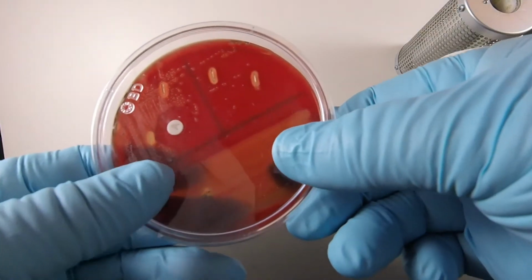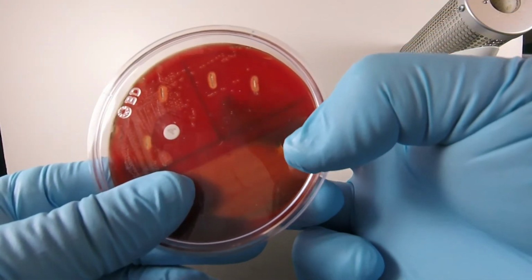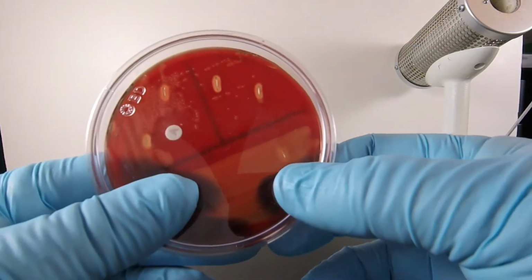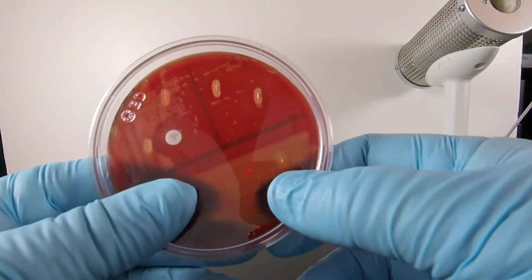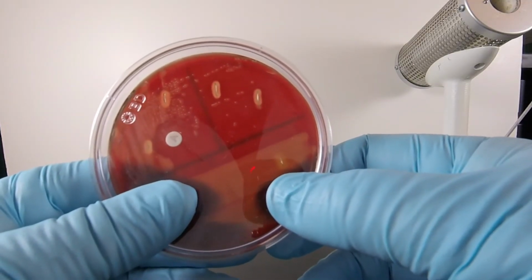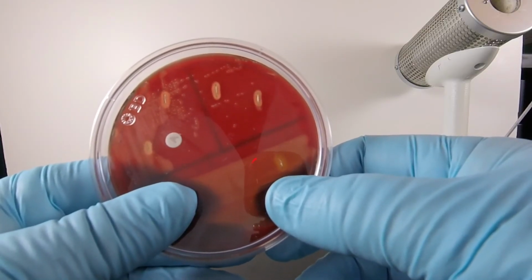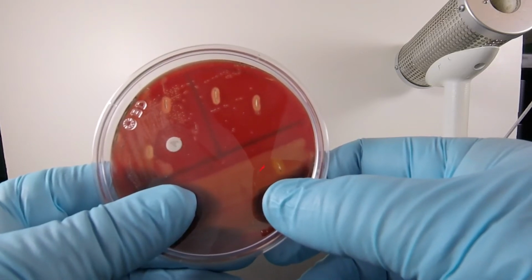So we can see on this particular beta bacterium that around the individual colonies in here, we see what looks like a clearing halo that's starting to go through the agar. That's where the hemolysins produced on the surface by the bacteria are making their way down through the agar and lysing the red blood cells. In a couple of days, that would become totally clear.